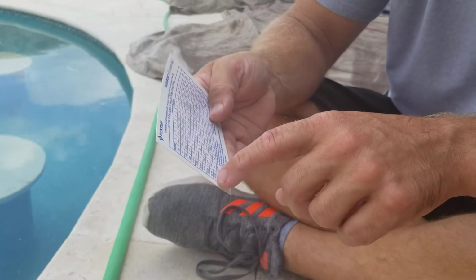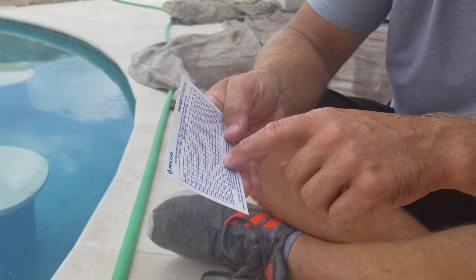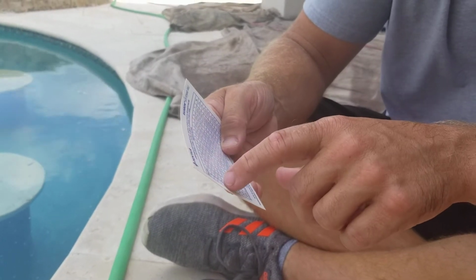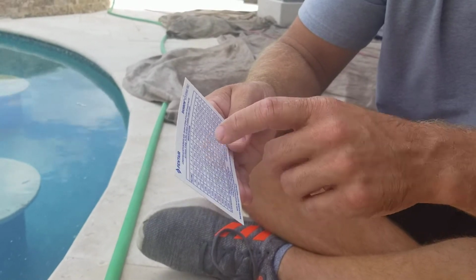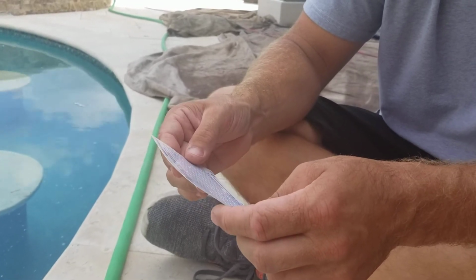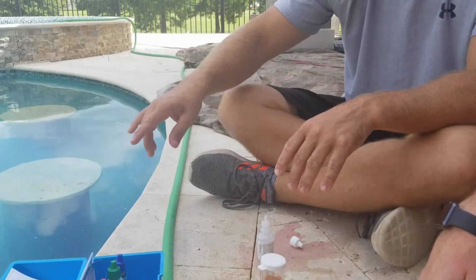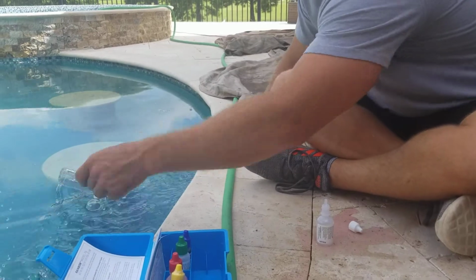Gotcha. So we'll go to 35,000, 4.5 quarts. Then we'll do another 2,000, so another 8 ounces. Okay, so pretty much 5 quarts. Yeah, I was gonna say it's right there. Of acid. We won't put the acid in right now. We'll wait because we got to do the alkalinity test next. You always adjust alkalinity first.